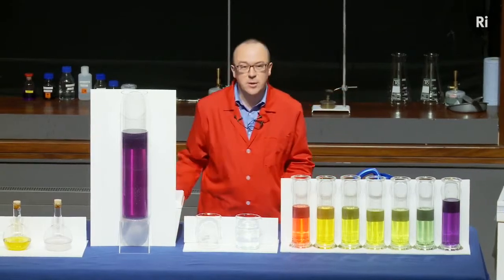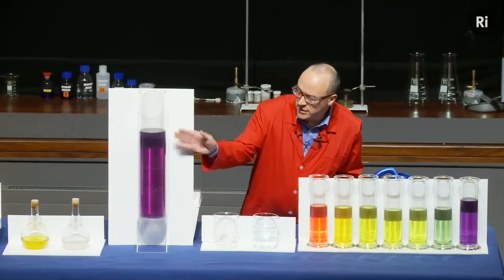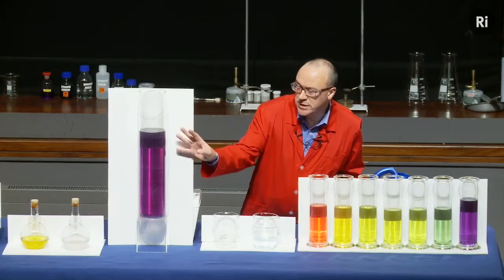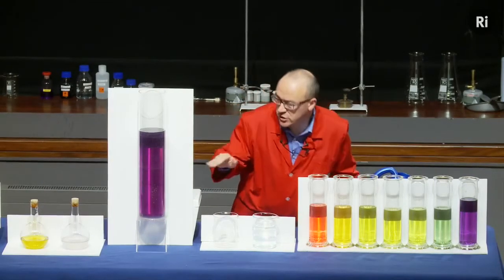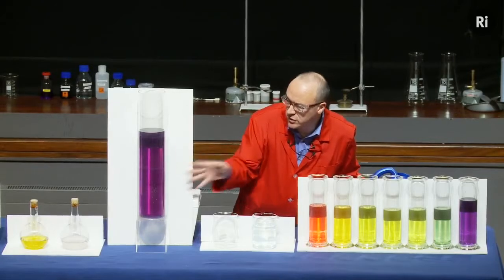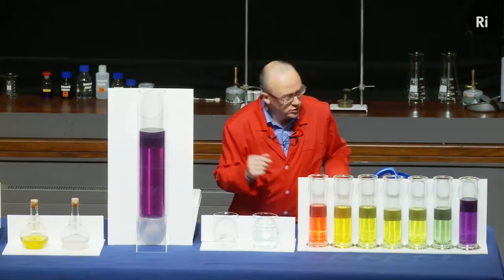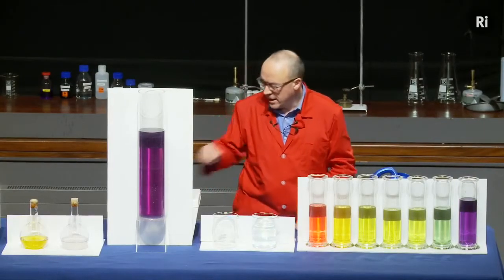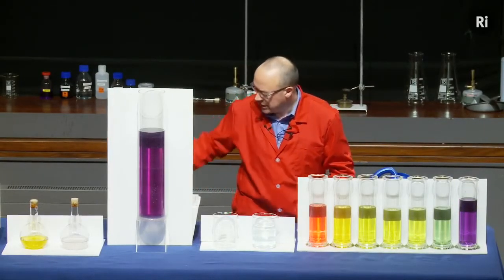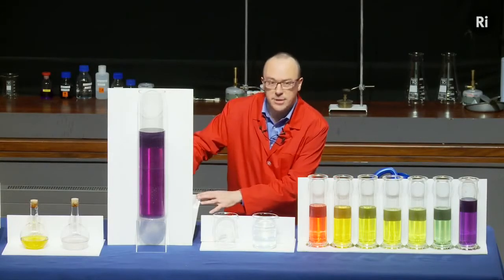But let me just show you now another example of a reaction involving universal indicator, and it's this column of water which has universal indicator and also a little bit of sodium hydroxide, which is alkaline, and so it's turned it this sort of bluey purple colour. And we're going to add some acid, and we should see it go through a sequence of colours rather like these. Now the particular acid that I'm going to use is acid that's going to be made in the water from carbon dioxide.